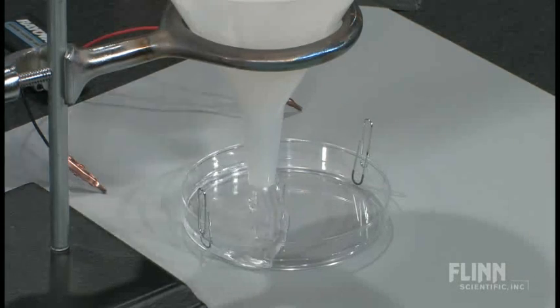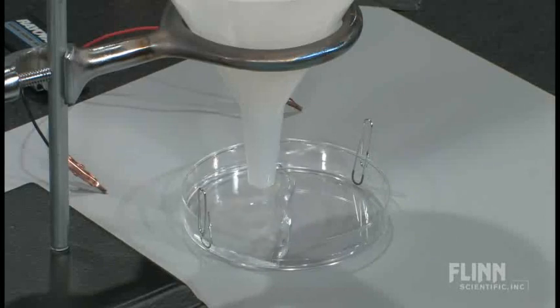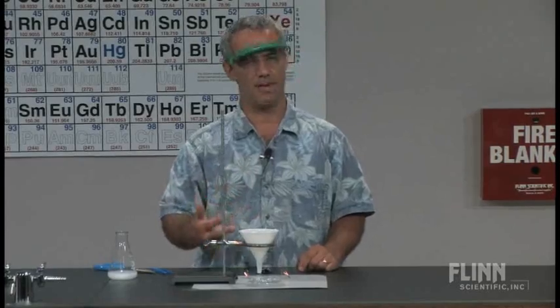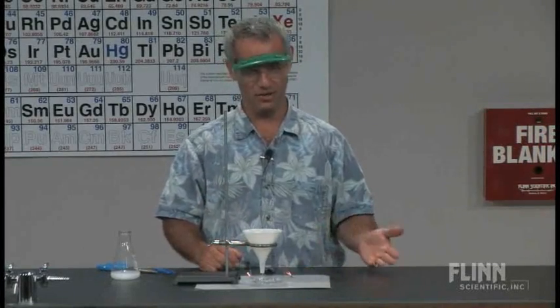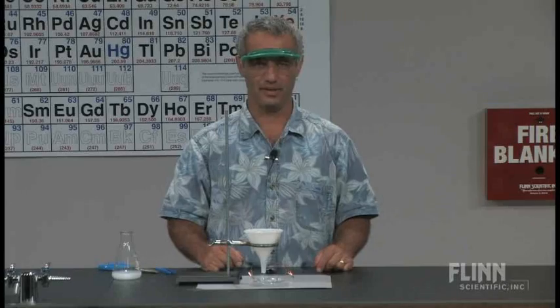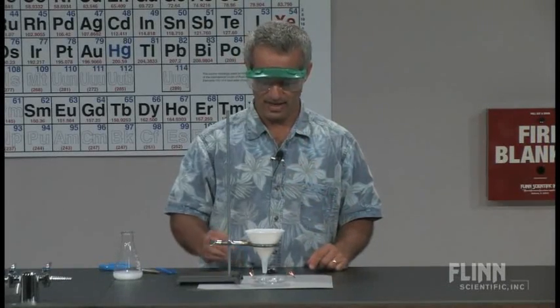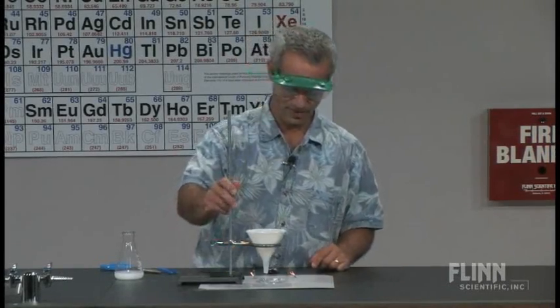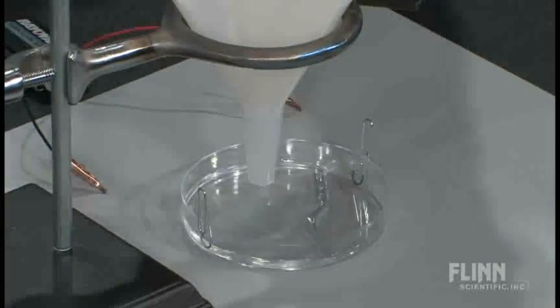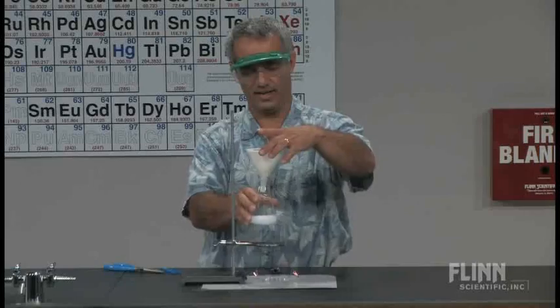You don't need a very thick layer of it as long as it covers the bottom. Tin, keep in mind, has three common oxidation states: tin neutral, tin 2-positive, and tin 4-positive. And that does have a consequence in this demonstration. So, here we go — we're going to move this aside, simply by setting it back into the flask.